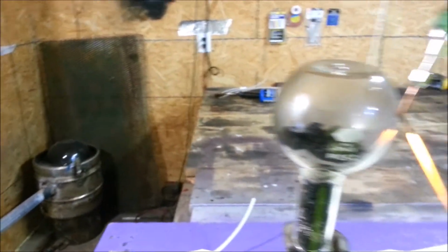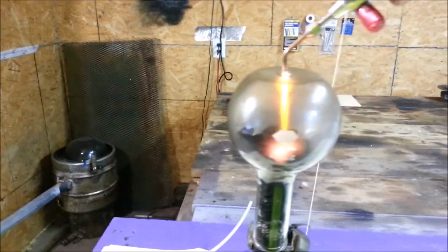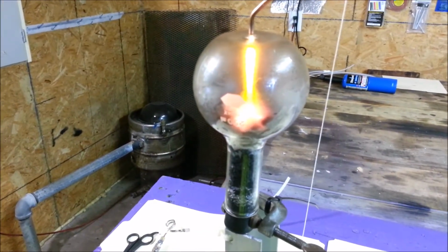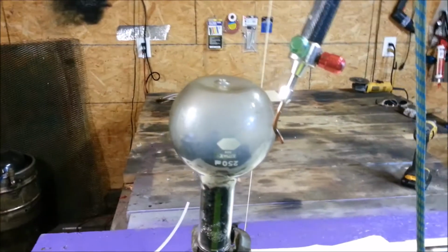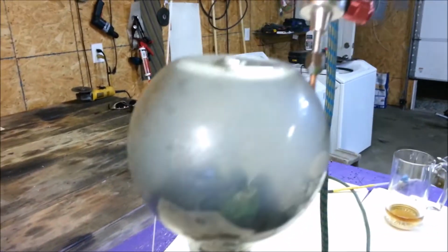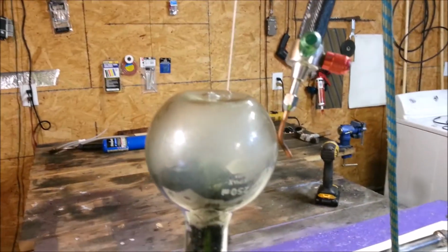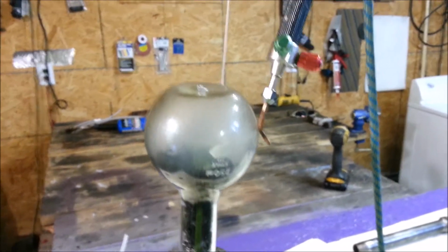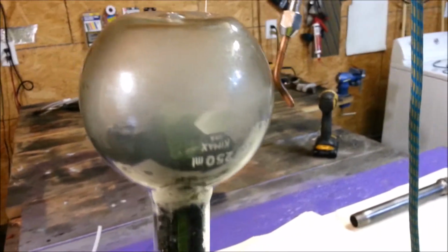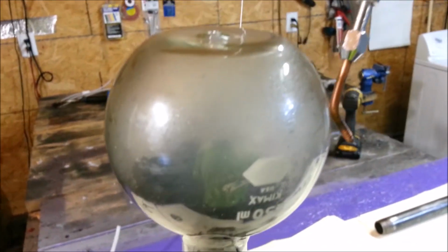Okay, try this again. Yep, it went out again on me. Not exactly sure why it's extinguishing. Definitely a problem. I think I just need a more ferocious flame. Not cool. Okay, I gotta air it out again, because as I said, if I just light this and stick it right back in there now, it will explode.